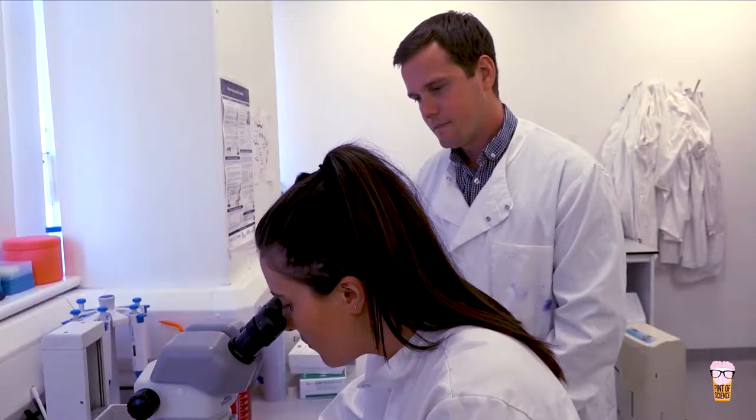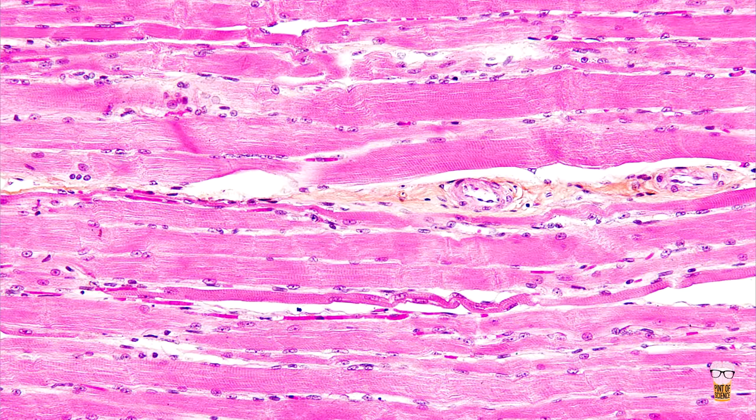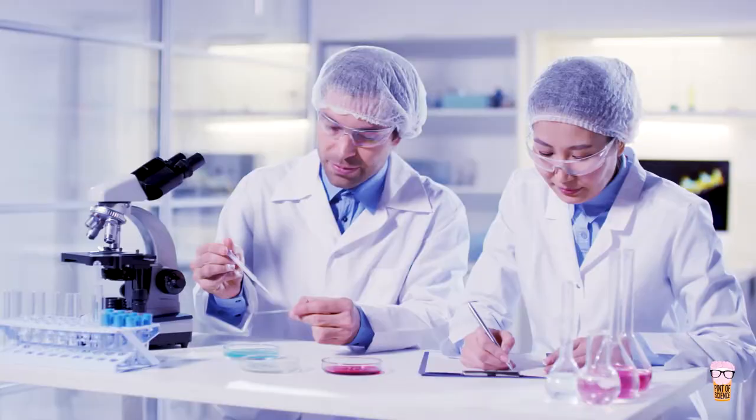To measure the mitochondrial response to an intervention, we take a tiny tiny piece of muscle tissue and under a microscope we pull it apart so that we can see the individual muscle fibres.